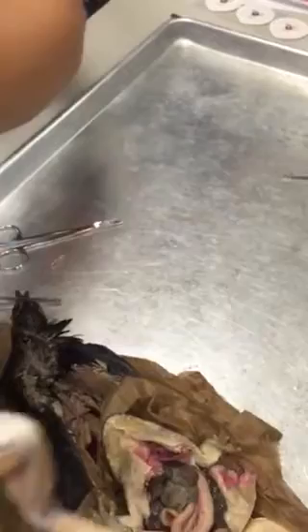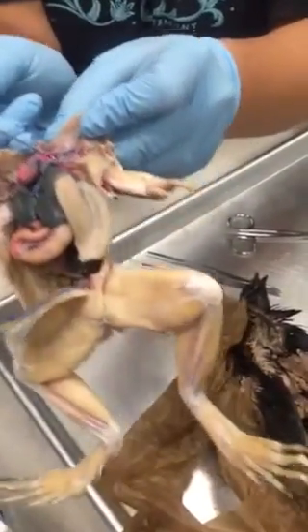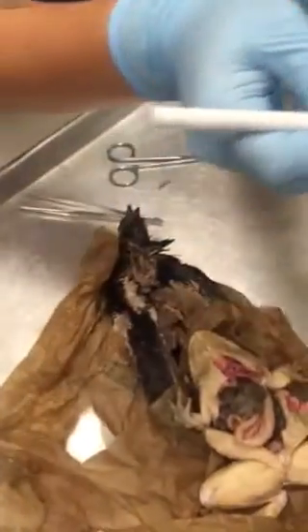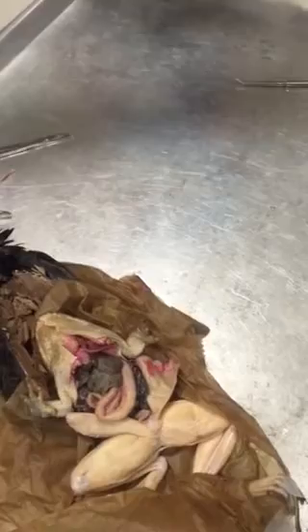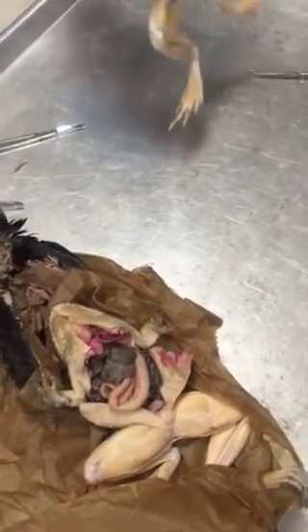Okay. And the carotid arch has 2 branches, and one of the branches has this big bulb on it. See the bulb, that round bulb right there? Okay. That's called the carotid body. And the carotid body is in charge of measuring oxygen and carbon dioxide levels in the blood.